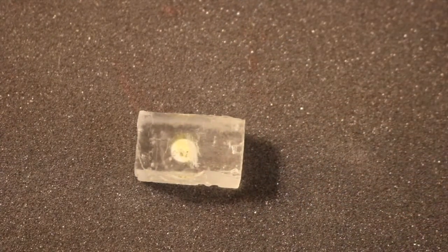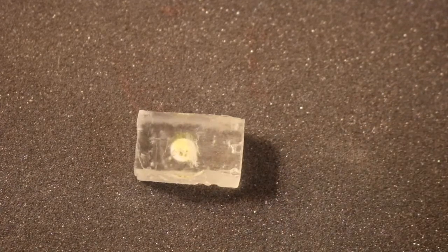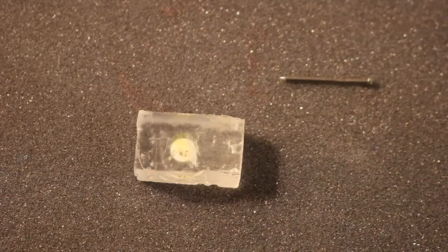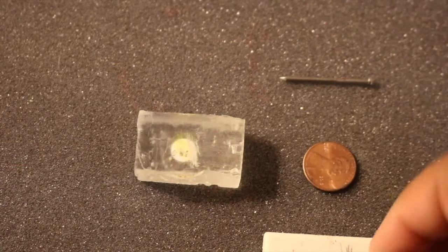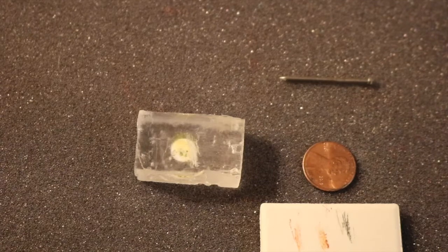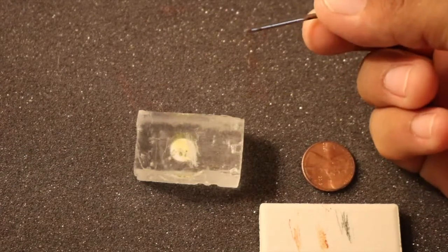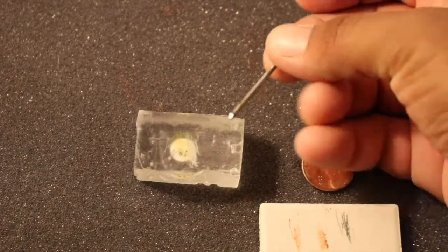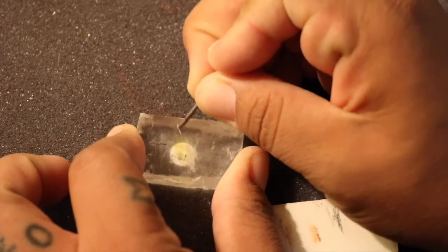The next one we could use is hardness. So that's essentially a mineral's resistance to scratching. Now remember, we have a couple different common tools that we can use to help determine hardness. Those include a nail, a penny, a streak plate, and your fingernail. So now remember, when I like to test for hardness, I always like to start with the hardest tool. So that would be the nail here. So this nail here has a hardness of 5 to 5.5. So what I'll first do is I'll take this nail and I'll scratch it on the surface of the mineral.